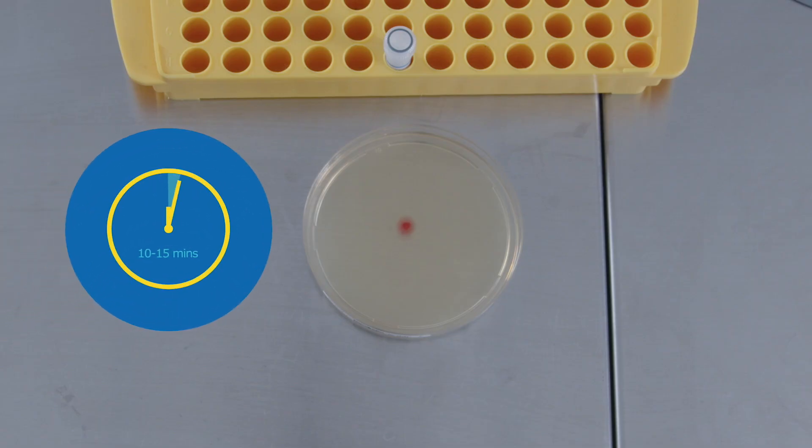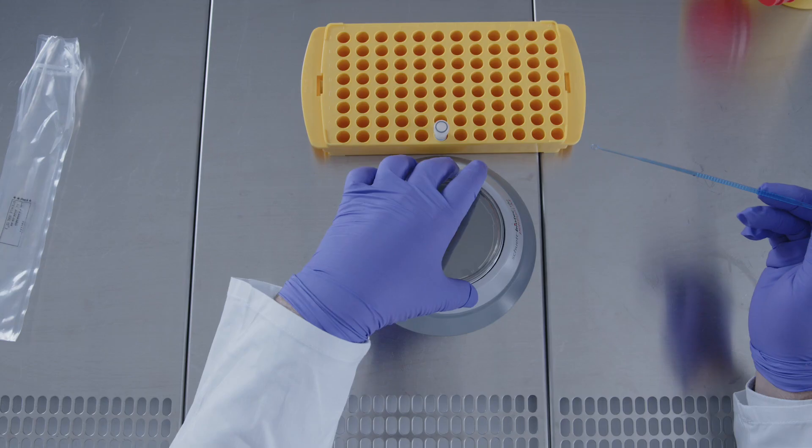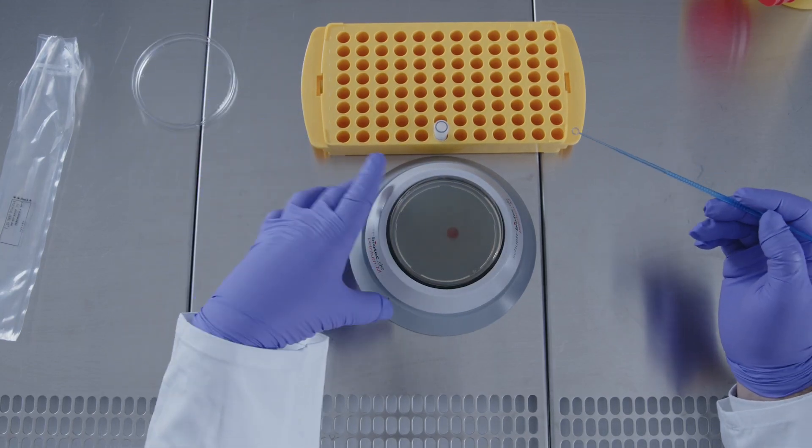After 10 to 15 minutes, check that it has fully dissolved, leaving only a drop. Spread the drop over the entire plate.